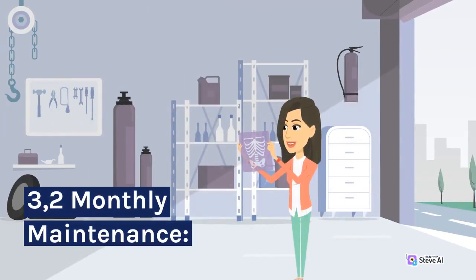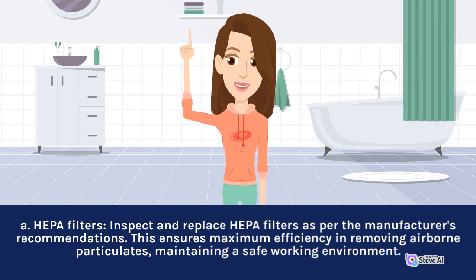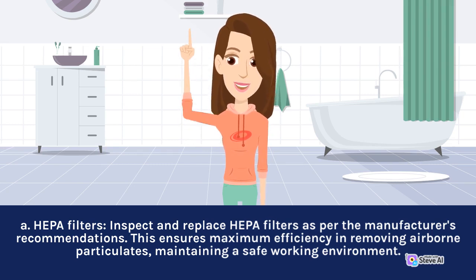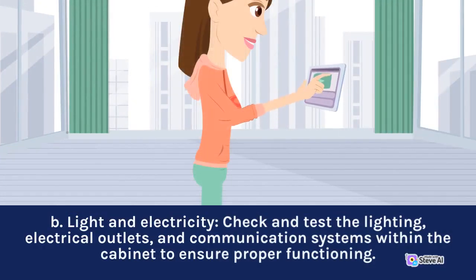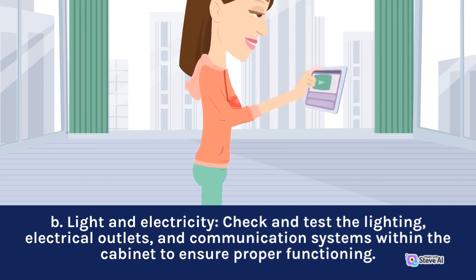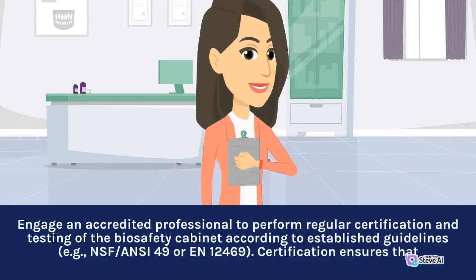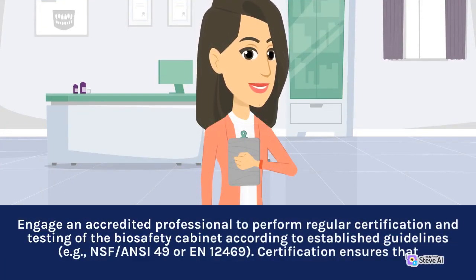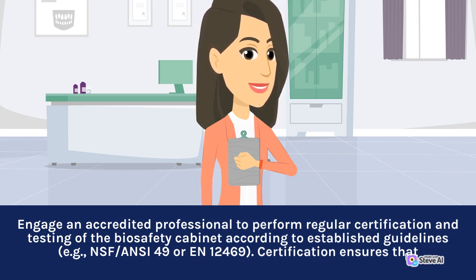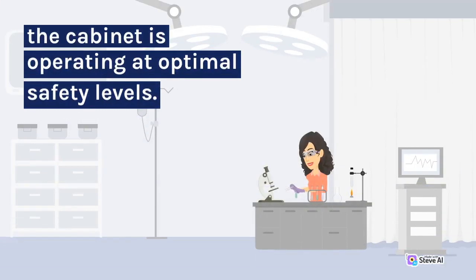Monthly Maintenance. A. HEPA Filters: Inspect and replace HEPA filters as per the manufacturer's recommendations. This ensures maximum efficiency in removing airborne particulates, maintaining a safe working environment. B. Light and Electricity: Check and test the lighting, electrical outlets, and communication systems within the cabinet to ensure proper functioning. Routine Certification: Engage an accredited professional to perform regular certification and testing of the biosafety cabinet according to established guidelines, for example NSF-ANSI 49 or EN12469. Certification ensures that the cabinet is operating at optimal safety levels.